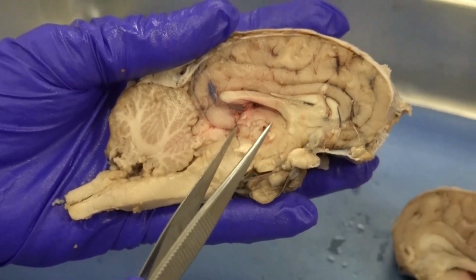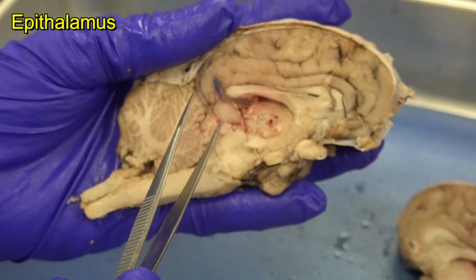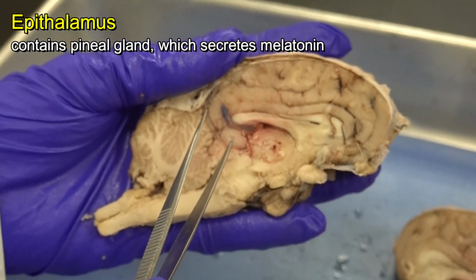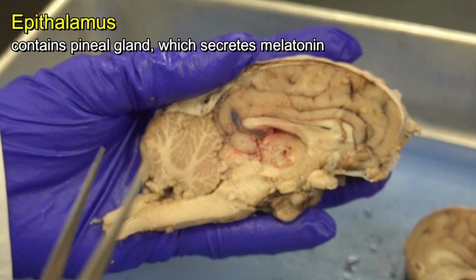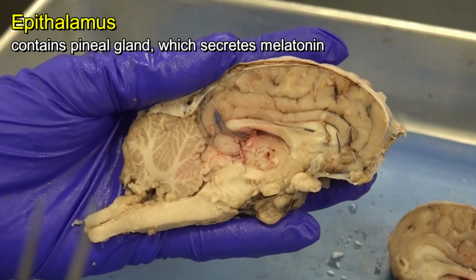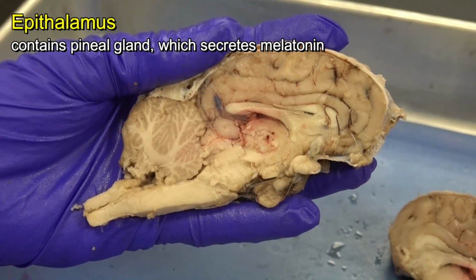Now I go back to the thalamus. From the thalamus, I go posterior and I can find the epithalamus. And the part of the epithalamus that in this brain we can see easily is the pineal gland. Recall, the pineal gland is the one that secretes a hormone named melatonin. During daytime, secretion of melatonin decreases, so we can stay awake. But when it's dark, secretion of melatonin from the pineal gland of the epithalamus increases, which leads to sleepiness.